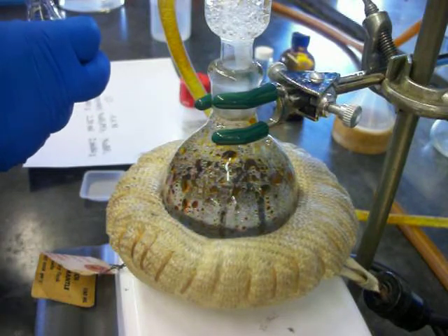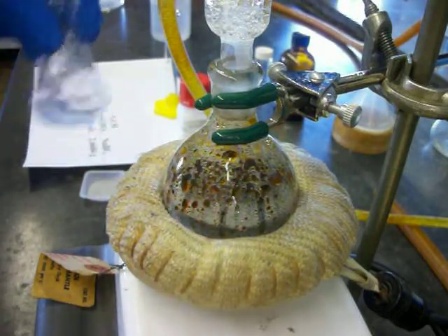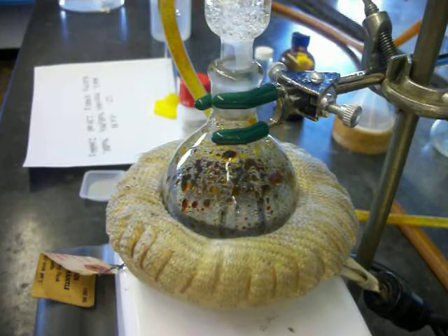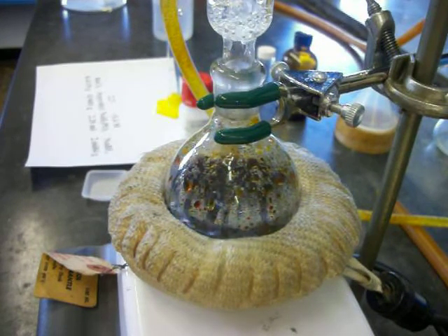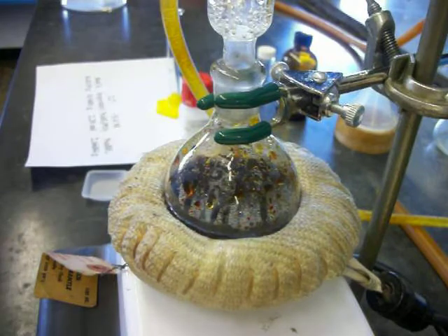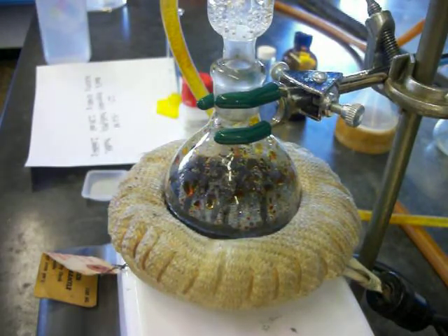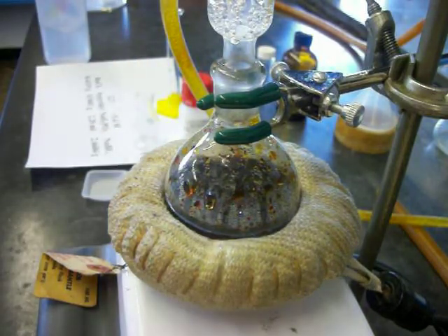That will cool the system down a bit, so I will have to heat it back up to reflux. Unfortunately that dissolves pretty quickly. We'll pour that in the top and apply a small rinse of deionized water to add with that. And you see immediately the reflux stopped.